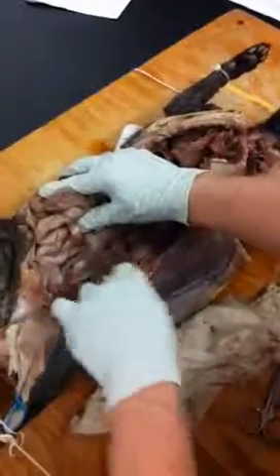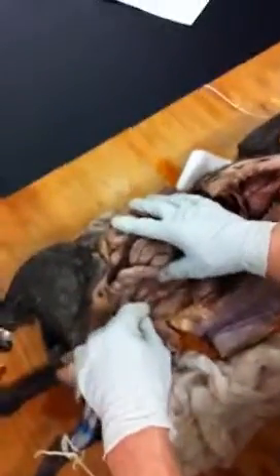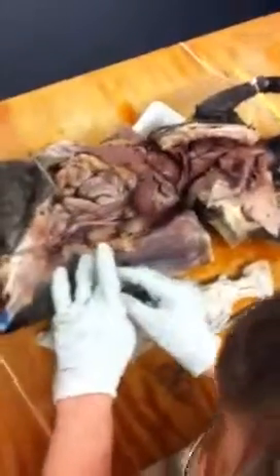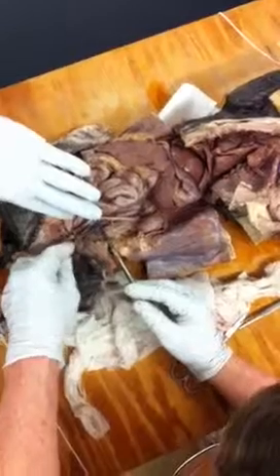The iliac vein. So now, if we go back up into the abdominal region and we find the inferior vena cava here, and we follow it posteriorly where it's actually draining. If I move the abdominal aorta out of the way, I'm going to put a probe there. I'll get another probe and lift up, and you can see that the vena cava also splits. You can see that there's a Y, but it's not in the same position as the Y in the arteries. It starts sooner, okay?